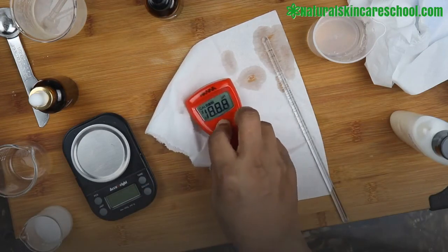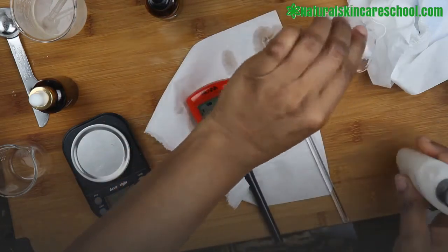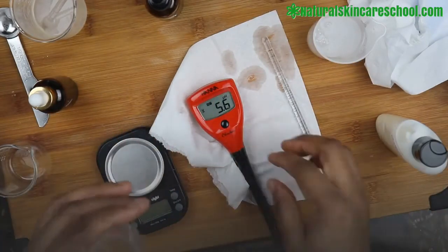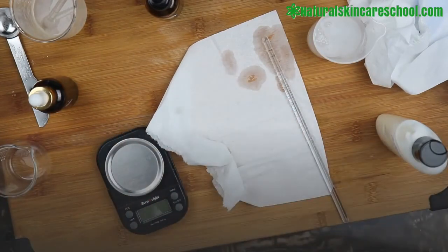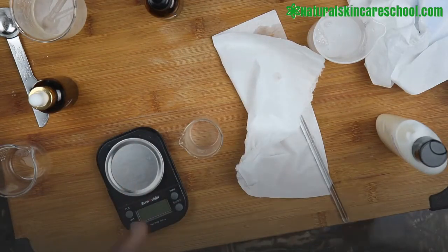Remember, you take one gram of whatever you have, you put it in a beaker, then you add nine grams of water to it.